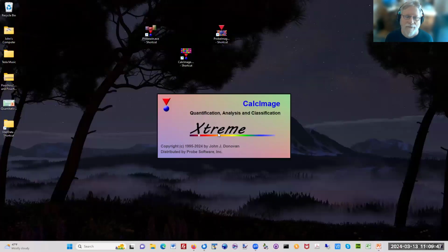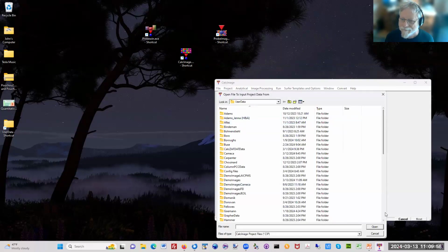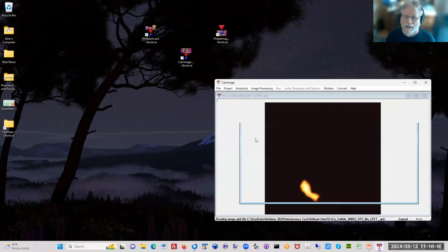We'll go to CalcImage. And we'll open up that project. Webinar 24, and here's an interference test. And the cool thing, one of the things you can do with CalcImage is you can make a copy of your raw data and you can process it in multiple different ways. And in this case, I processed it without the interference correction. And that's this project here.